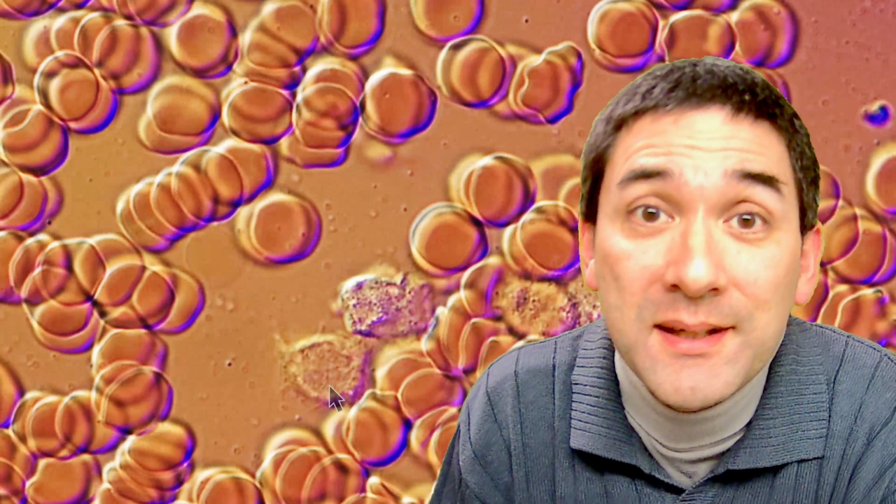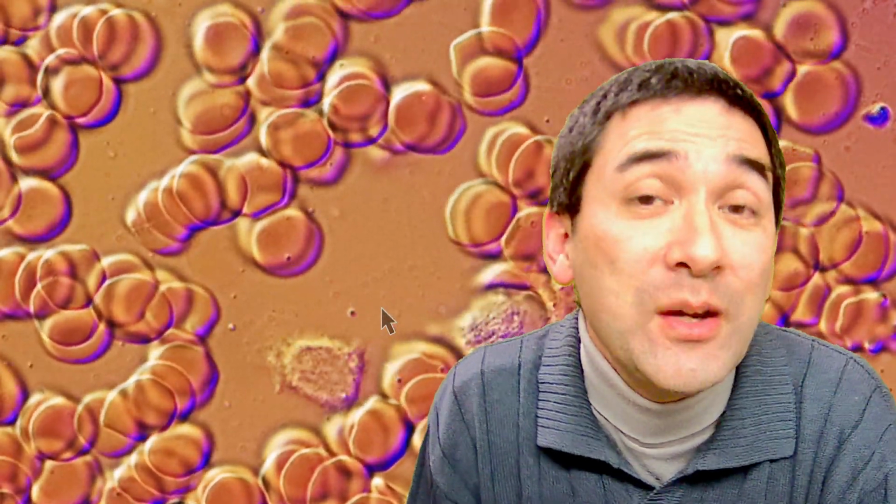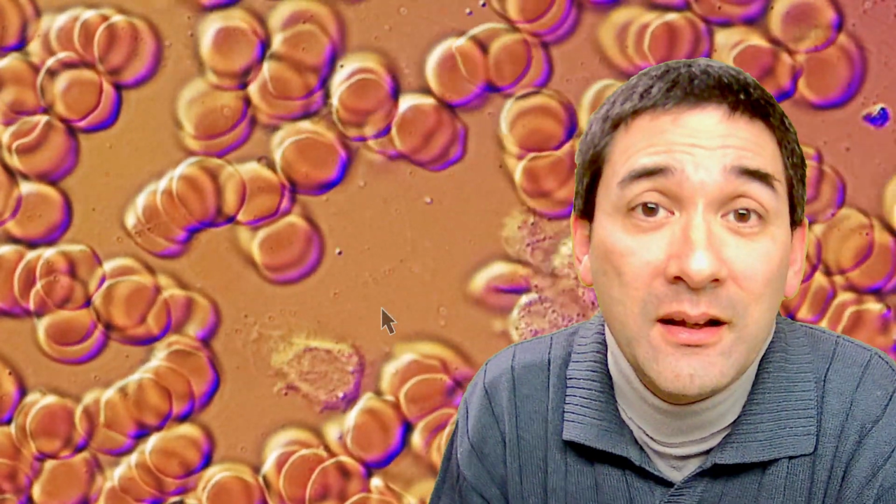Now, I paused the video right now because I want you to have a very close look at this funny little cell over here. When I start the video, look what this one does, because this is actually quite nice. Look, it starts to move and crawl. This, as a matter of fact, is a white blood cell. Some of the white blood cells are able to move because they are hunting for bacteria, and they're eating up bacteria, and therefore they're able to prevent, or at least they're able to prevent diseases.